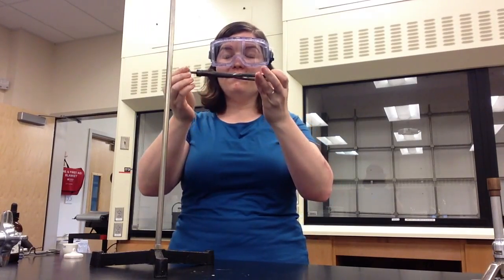In this experiment, you'll be using a ring stand to hold your sample in place. On the ring stand, you'll need to put a support ring. These can be found at the front of the classroom.